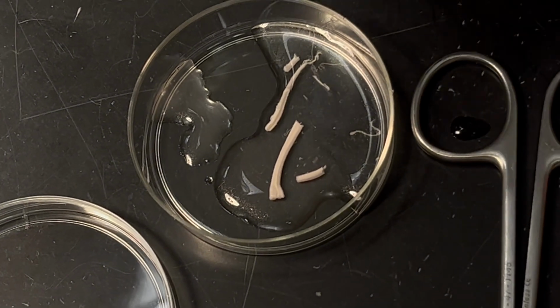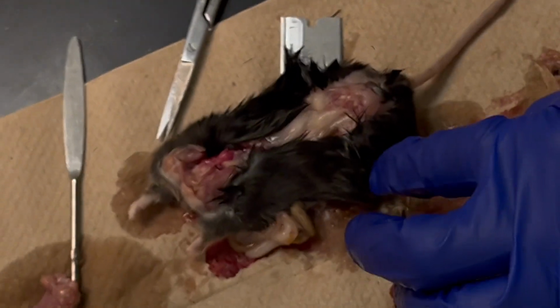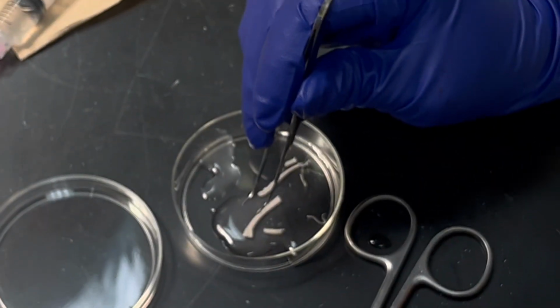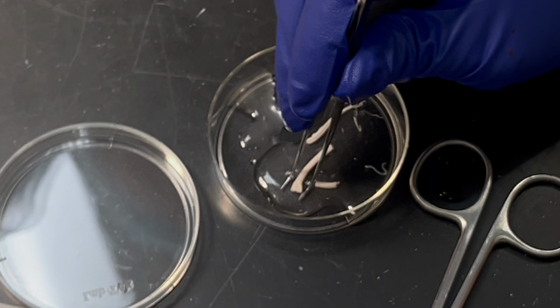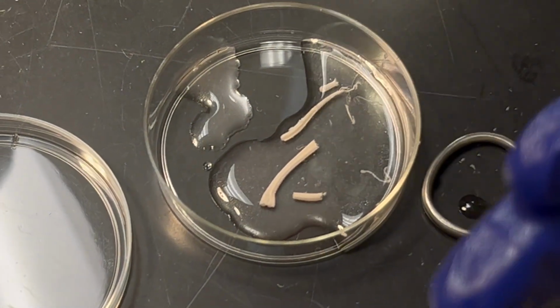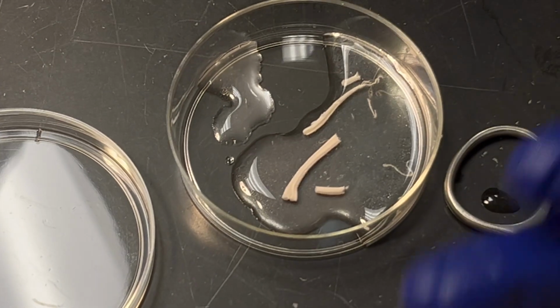So in reality, it was like this. And this is where the sciatic nerve injury was. So if you then line up from rostral to caudal, this side is your lumbar spinal cord. Okay. And this is the side you did injury. So that's your ipsilateral side. Okay. And then the other side is the contra.